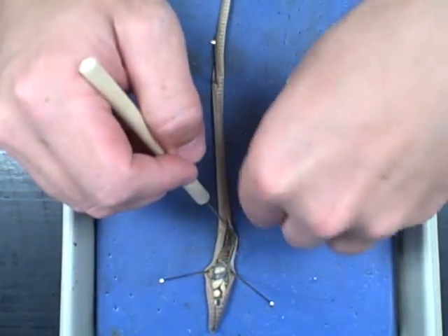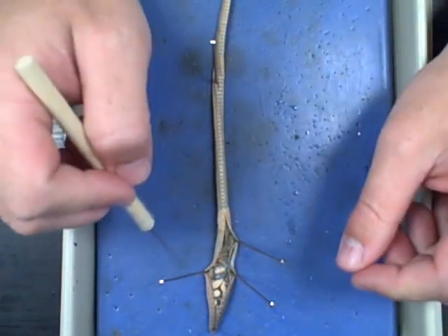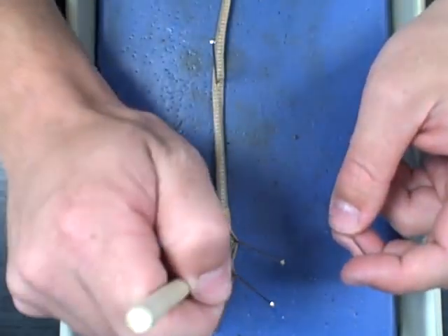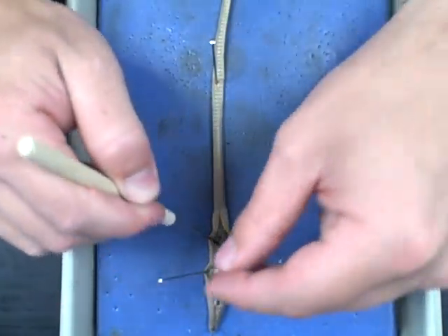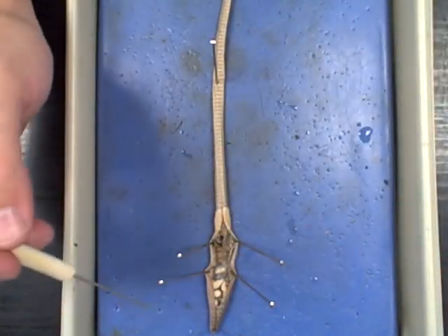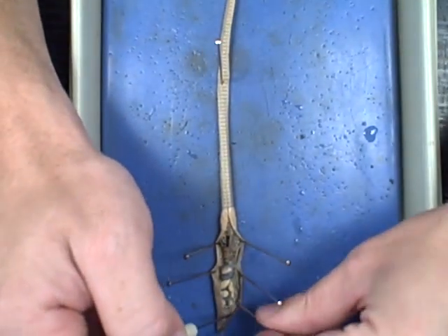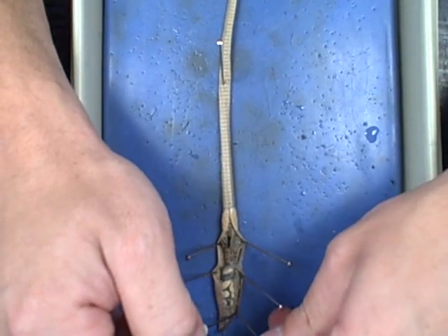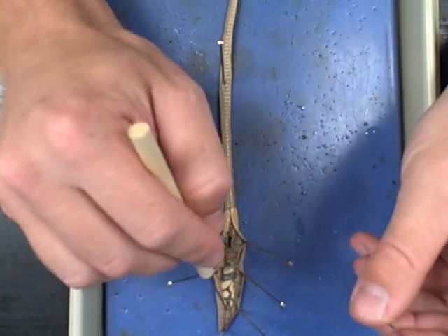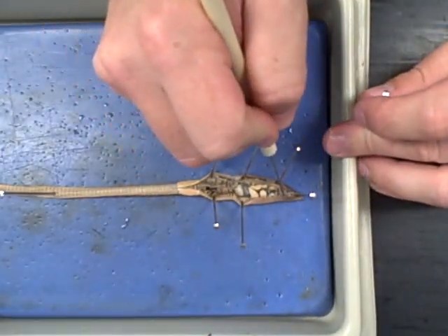You don't need a whole lot of pins — you could probably get away with just six: one, two, three, four, five, and six. Once you get these all in, you'll notice that if you used a very sharp scalpel like I did, you really don't even need to be pushing down when you go across the worm. Rotating when necessary is perfectly fine.